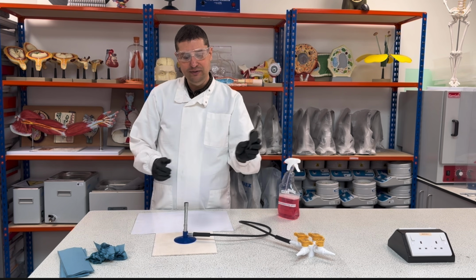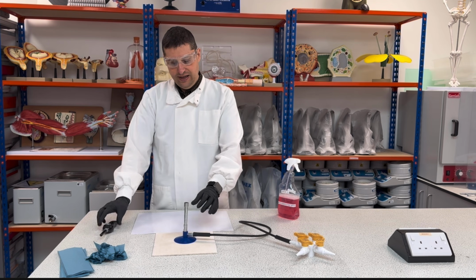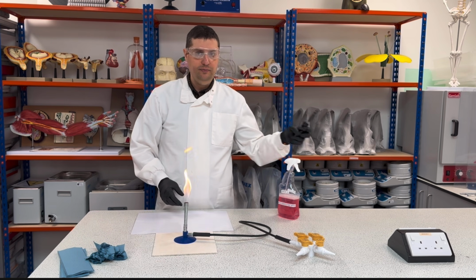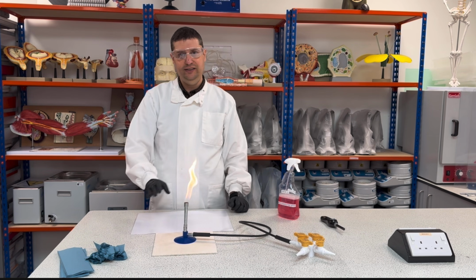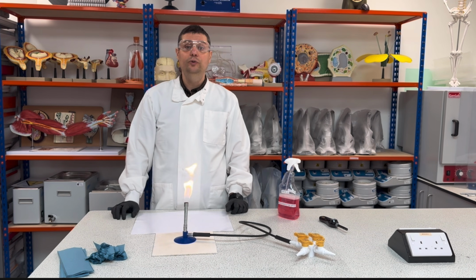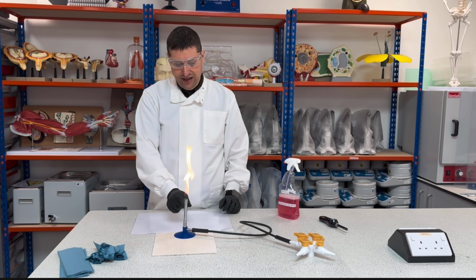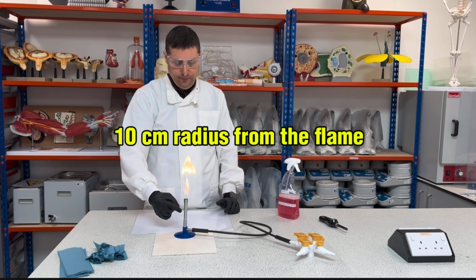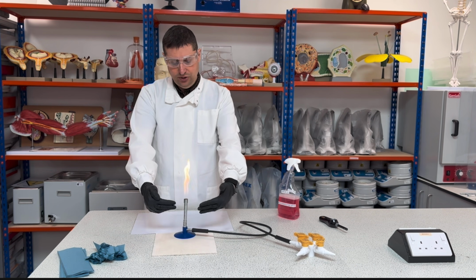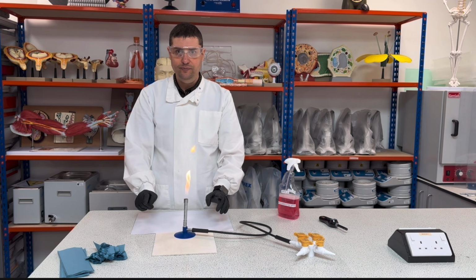So I will light the Bunsen burner, and I will choose the yellow flame. The yellow flame is important when I'm working in this stage to know the flame is on. Okay, so the area where I should work is about 10 centimeters radius from the Bunsen burner flame. Okay, so it's about this radius here. I call this area the sterile area.